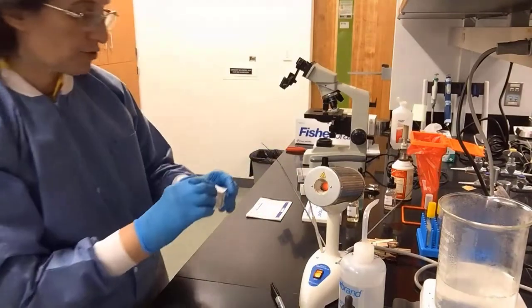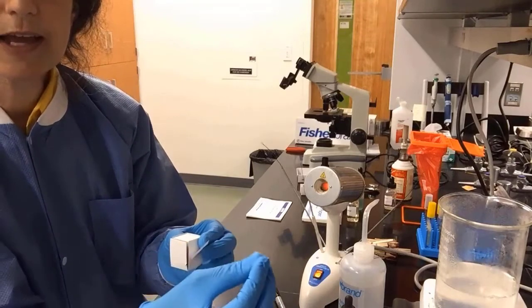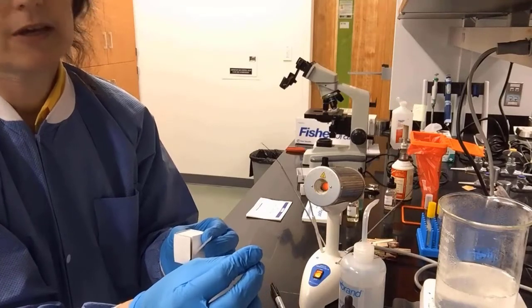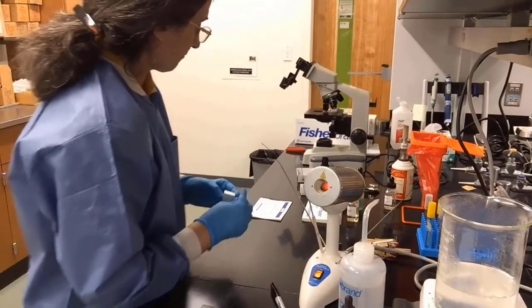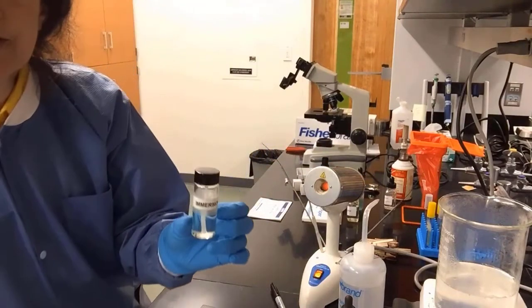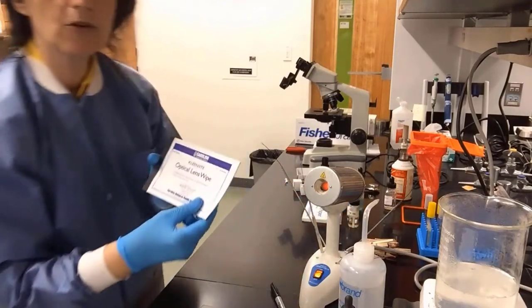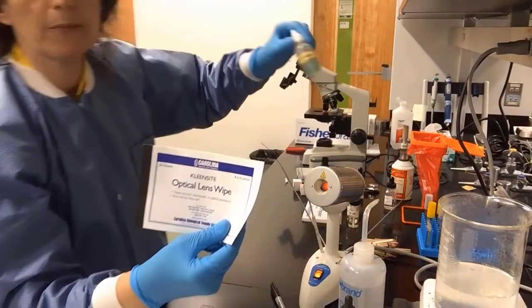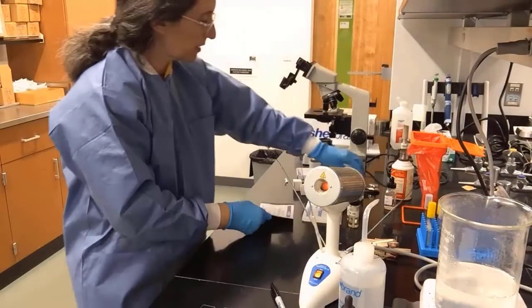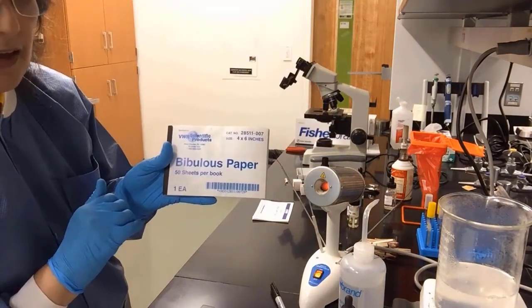We will also need cover slips to cover our slides, the little tiny square pieces that go on top of the specimen to protect the lens from the stain and the bacteria. Further, moving to the more materials, we have the immersion oil, which we will use with our 100X. To clean our immersion oil, we'll need the lens wipes and the cleaner, making sure we get all the oil off the lens. And we will also use bibulous paper to dry our slides.